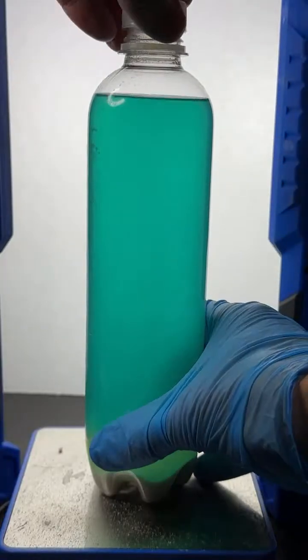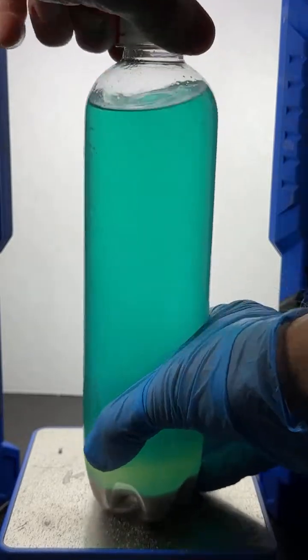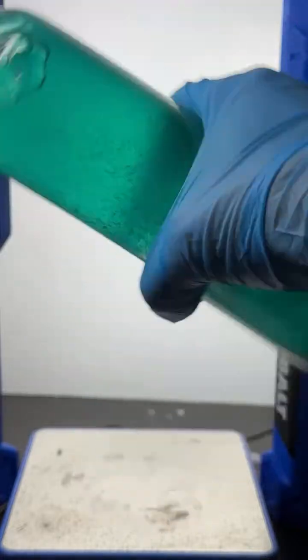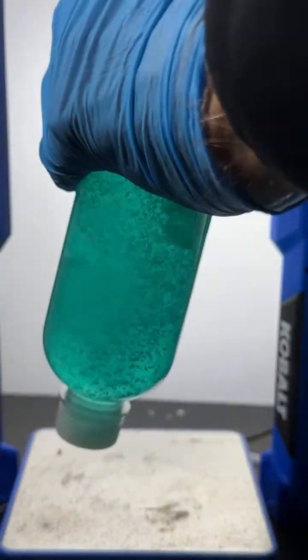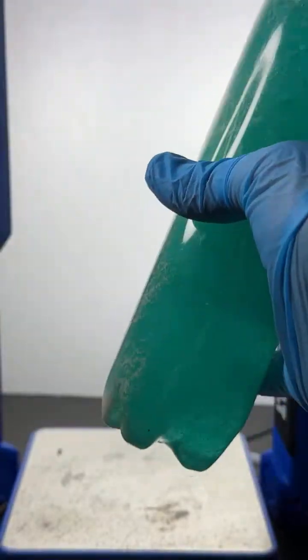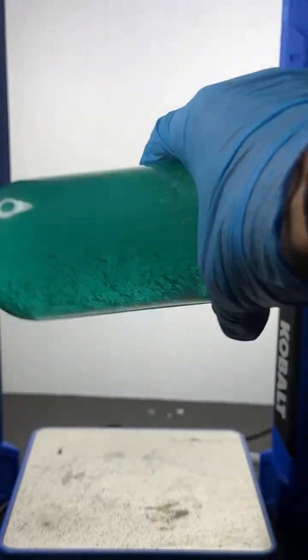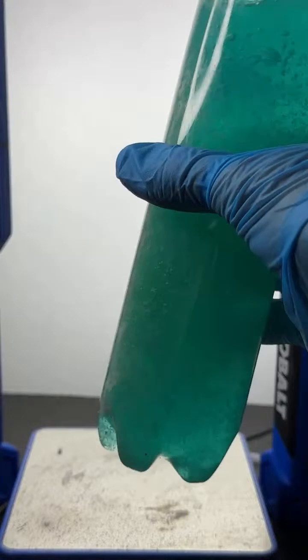Let's shake this baby up. Forgive me for not reading the comments right now. I'm focusing on the experiment, trying not to mess things up too much here. As I'm shaking, I'll be able to read. Yes, there is a very cool group of folks here from all over the world. NRM, I wish you a lot of motivation in your studying for your exam. Thank you there, one chemist.